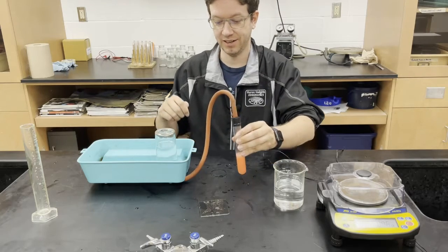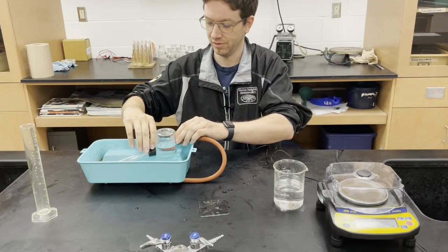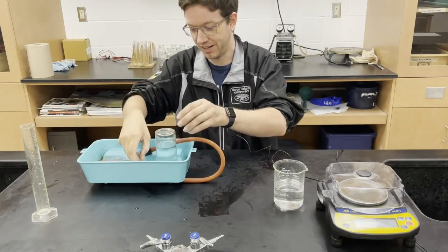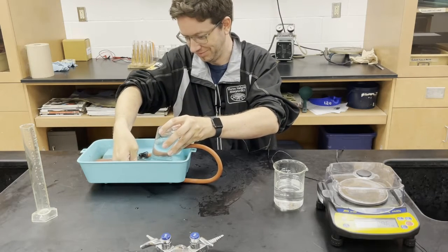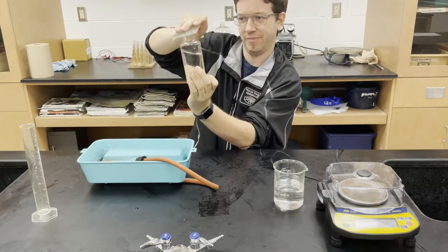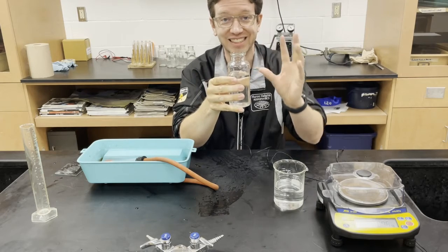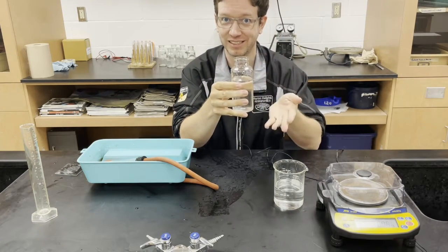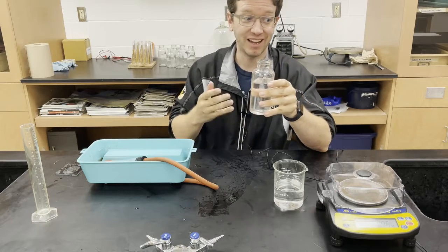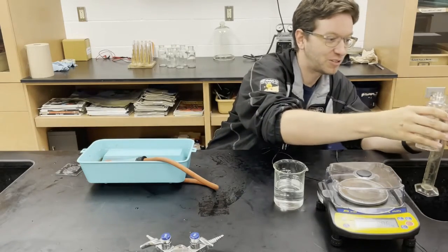It looks like we are done here. Don't put this below the water level. I'm going to take my glass plate again, put it underneath the glass jar, and with a little bit of finesse, lift it up, out, and over. Yes, the gas did escape, but that's okay because I just want to know that volume — it's the same as the volume of water that was displaced. We know from the beginning how much total volume this is, so all we need to do is figure out how much volume of water is left and subtract the two to figure out the volume of gas that was produced. So let's measure how much water is left.